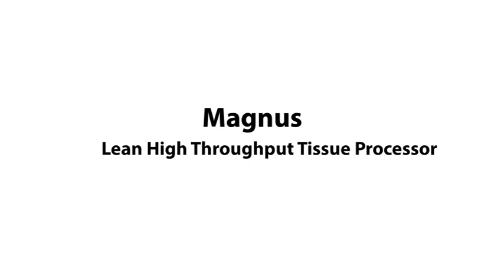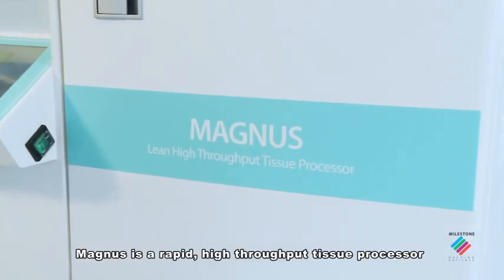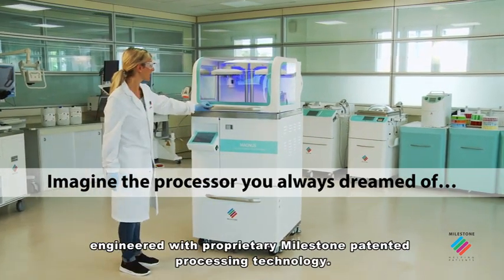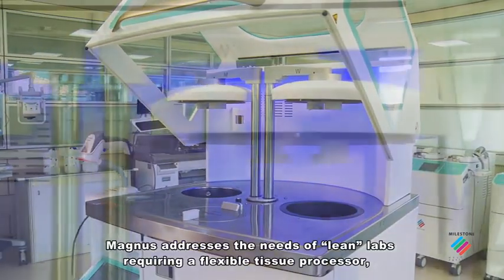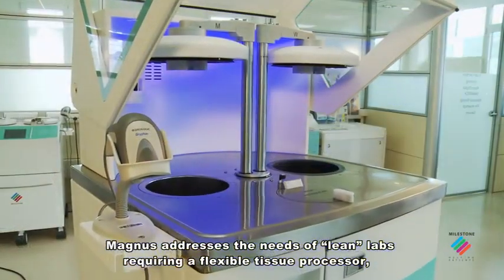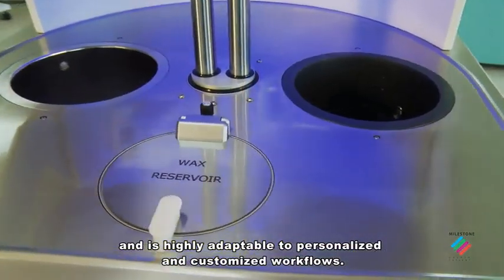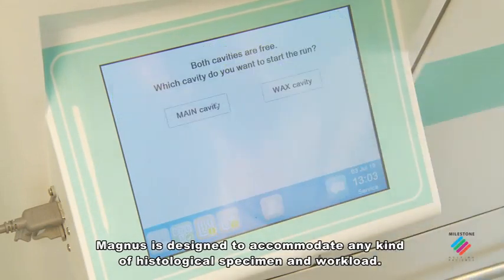Magnus is a rapid high-throughput tissue processor engineered with proprietary Milestone patented processing technology. Magnus addresses the needs of lean labs requiring a flexible tissue processor and is highly adaptable to personalized and customized workflows. Magnus is designed to accommodate any kind of histological specimen and workload.